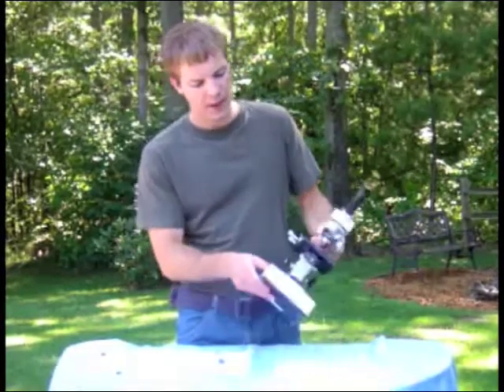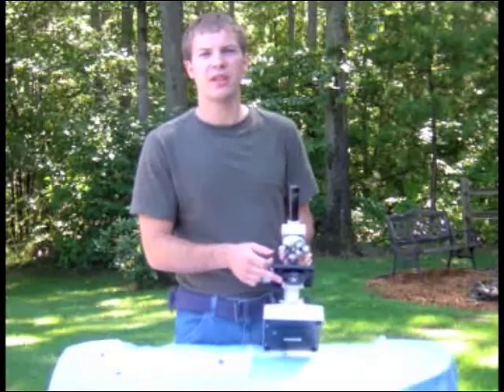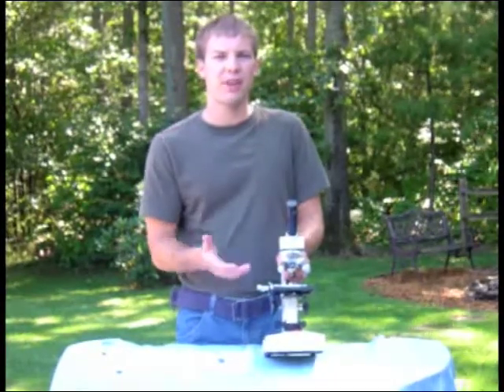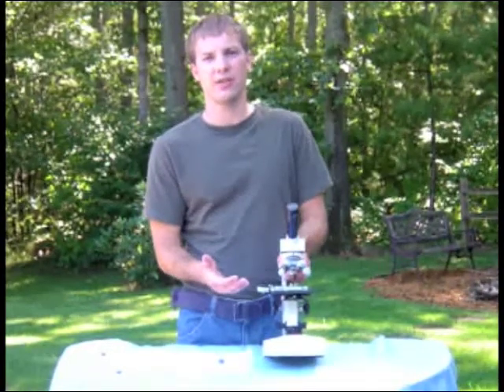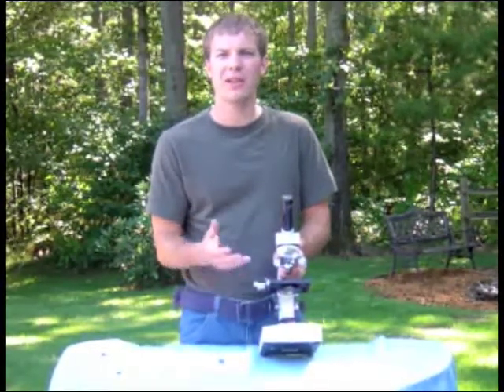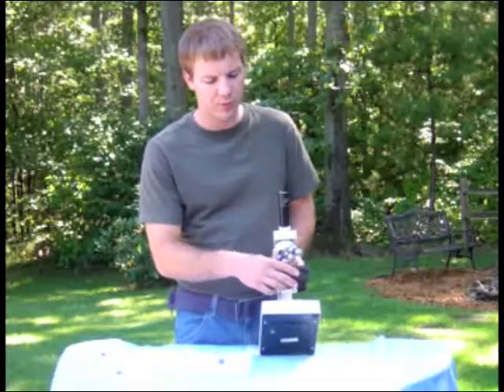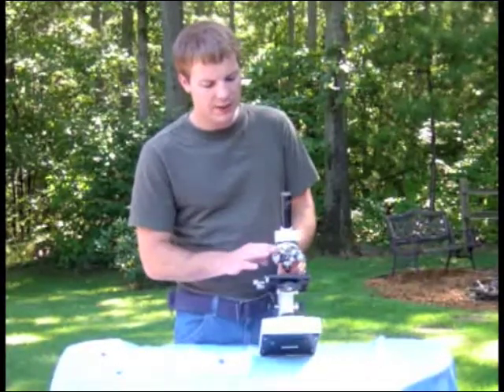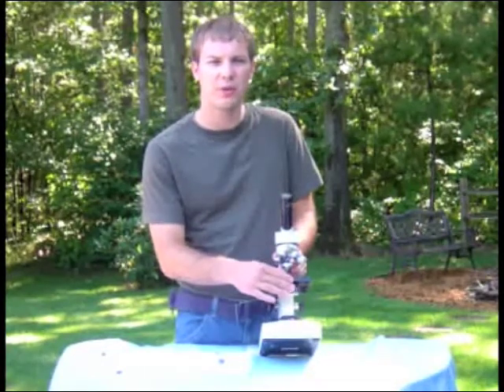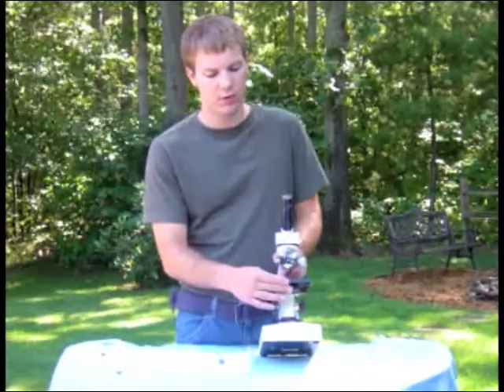The fourth and final thing is the diaphragm, which is located under the stage. It has different sized holes designed to let more or less light through the stage into the eyepiece. If you're working with something very thick or very dark, you want more light to shine through, so select the largest hole. If you're working with something very thin or very light colored, you don't want a lot of light because it'll wash out the picture and everything will look white — so use a smaller hole. Just like the lenses, the diaphragm clicks into place. If you don't click it, it'll block all the light and the eyepiece will just look black. So make sure you click it into place.